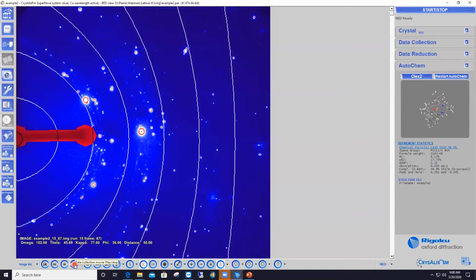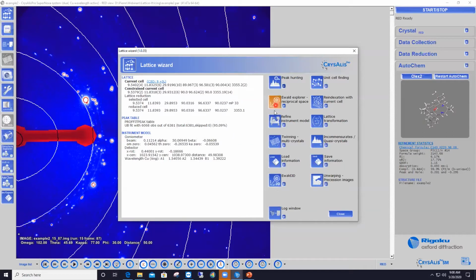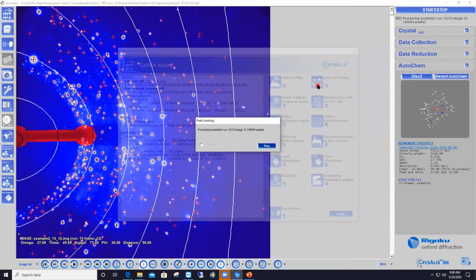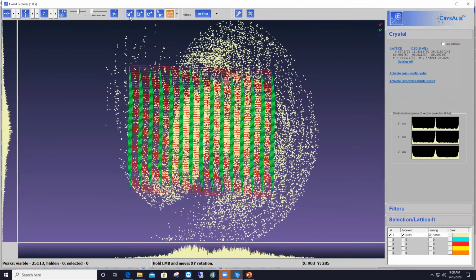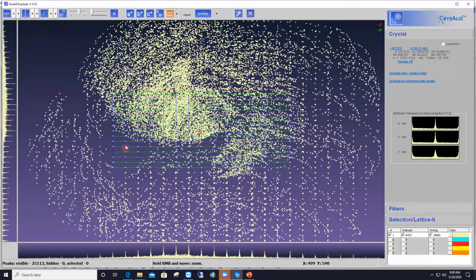Okay. Here is another way of looking at that dataset, in reciprocal space. If I open the Lattice wizard from the top button on the left-hand side panel, and then open the Ewald Explorer. Actually, let me run the peak hunting real quick first. And then open the Ewald Explorer, and you see what's going on here. We have a pattern of crystal reflections coinciding with the lattice points, and on top of that, we have a whole lot of ice features randomly spread throughout the reciprocal space.